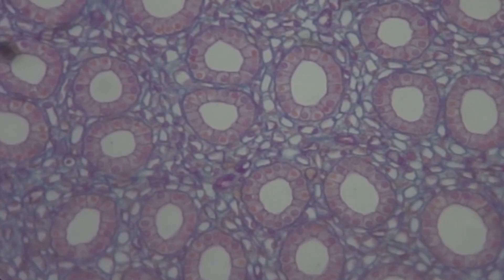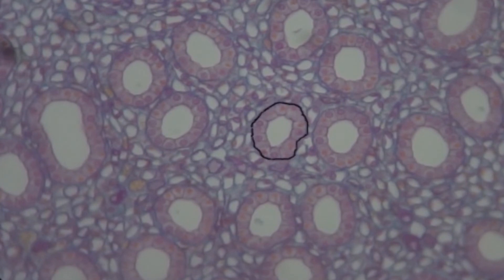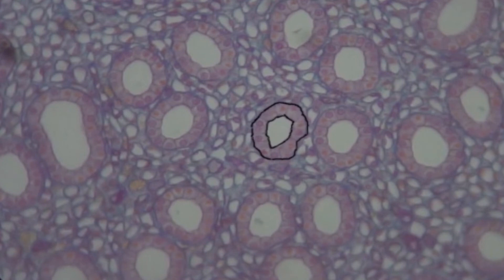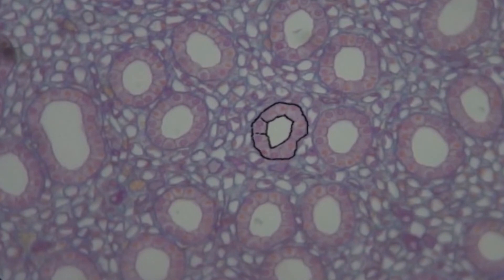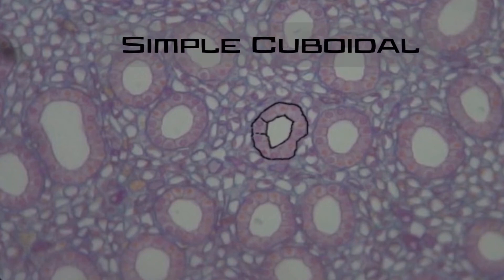The next slide is a cross-section of the kidney to see the kidney tubules — all these little tiny tubes inside the kidney. Getting a close-up of these kidney tubules, you can start to see the epithelial tissue surrounding the lumen. We can identify the basement membrane, and there's only one layer of cells between the basement membrane and the lumen, so this is a simple epithelial tissue. Outlining the cell, you can see the cells are about as tall as they are wide, meaning they're cuboidal. So kidney tubules are an example of simple cuboidal epithelial tissue.